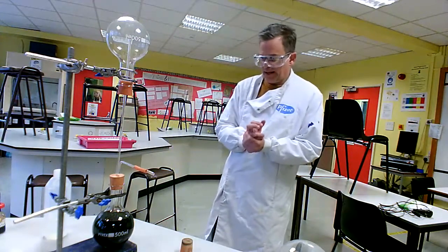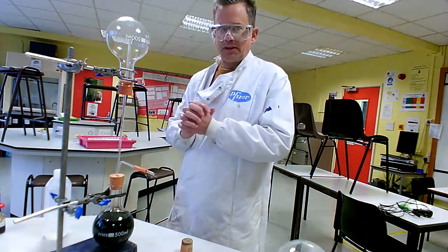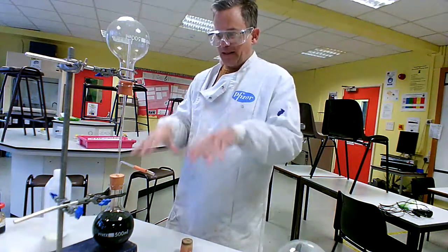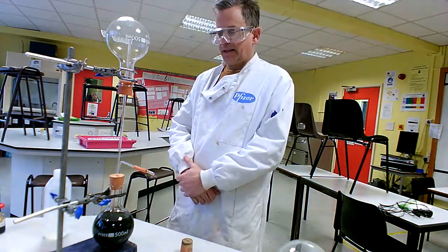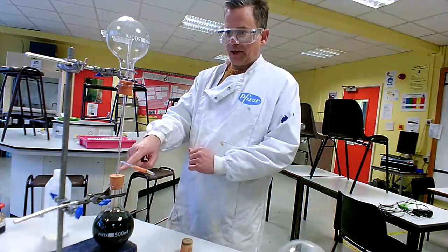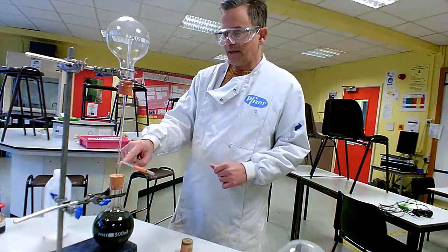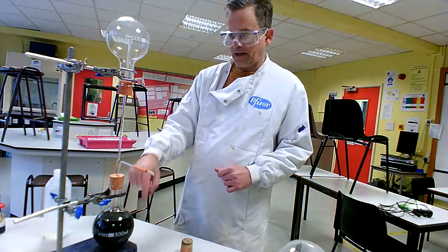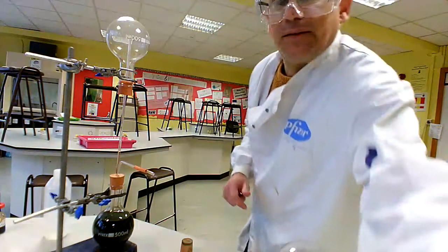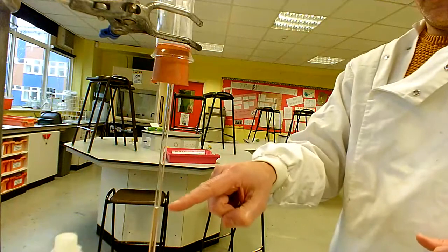Now there's a little bit of moisture in the flask already, and the spectacular thing about this experiment is what it does to water. You may know the saying that water finds its own level — water will always basically go and fill the bottom of the container that it is in, and it definitely doesn't go uphill. What we're going to see appearing just above the bung here is that this water from the flask at the bottom is slowly rising up. I'm going to move the camera closer so we can see that the water is going uphill.